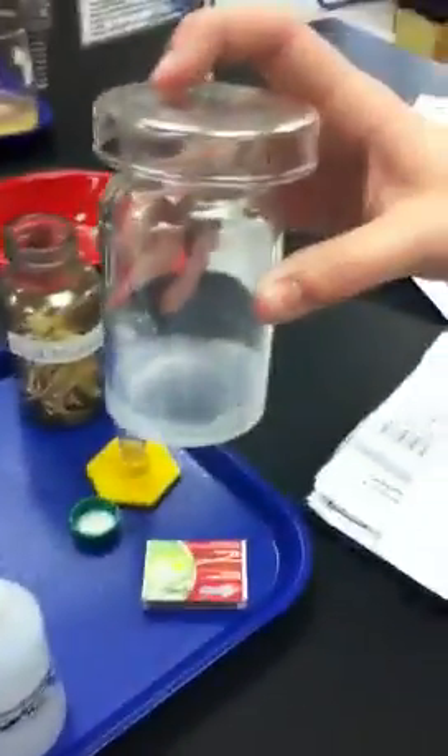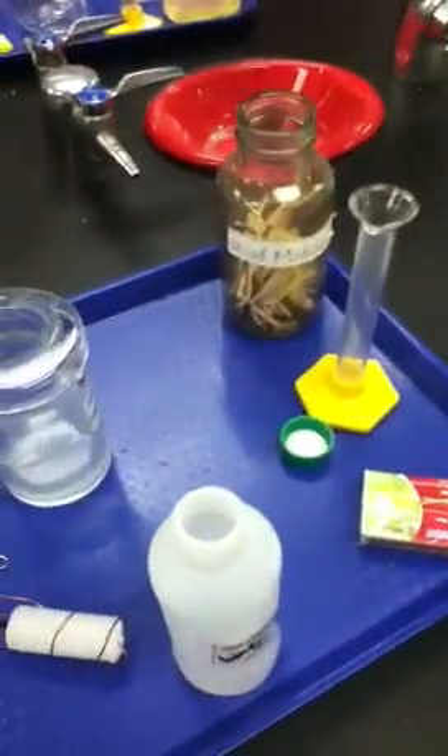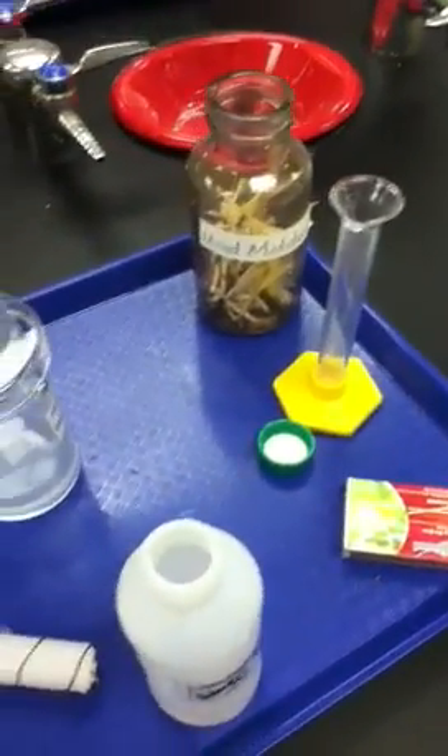And that's pretty much station number eight. Now we have to clean the contents — wash them out and then clean them. Make sure the matches are fully out before you dispose of them.